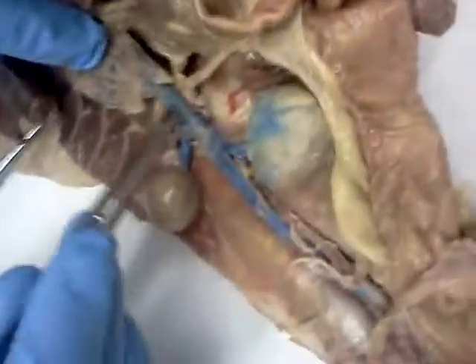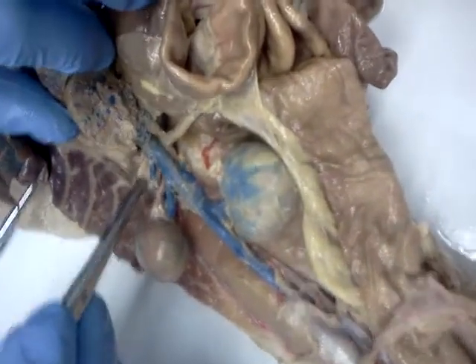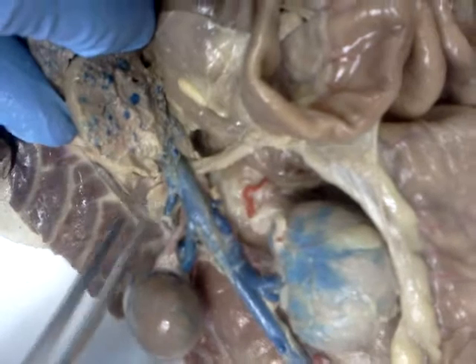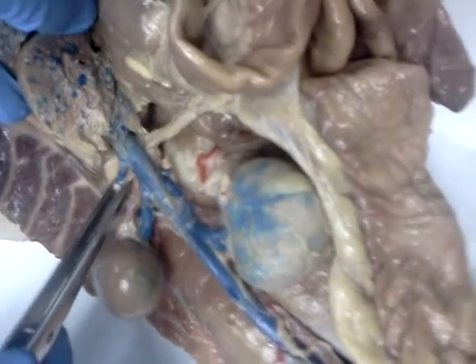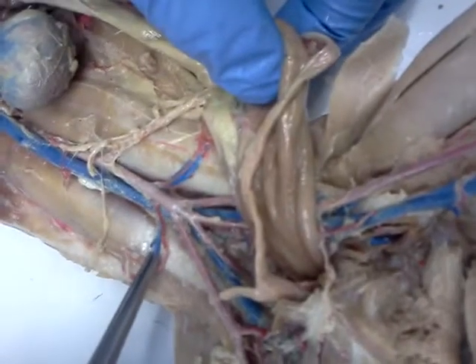As this comes down, we can kind of move the intestines out of the way and follow this here. We can follow the inferior vena cava coming down through the lobes of the liver, coming down here. If this is the renal, right here we have the renal, the adrenal gland, giving us the adrenal lumbar vein. Continually traveling downwards, you have the renal vein. Traveling still ever further down, you have the iliolumbar vein.